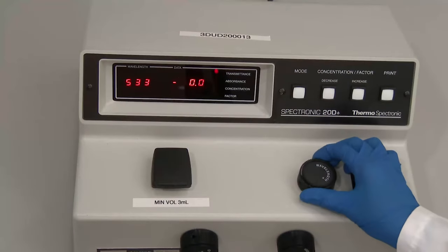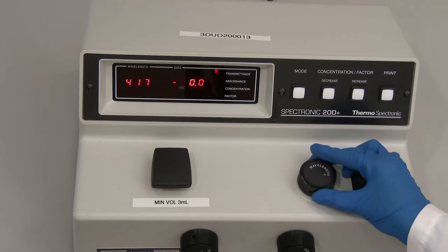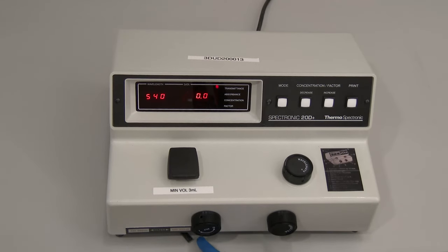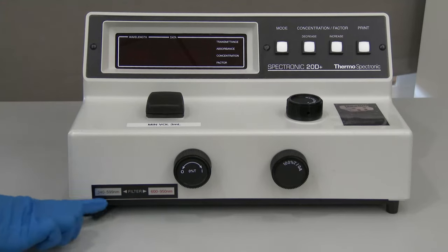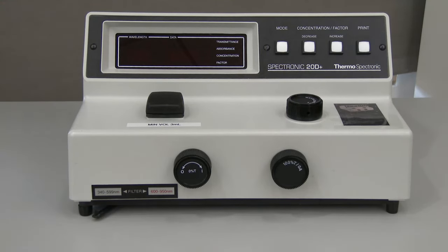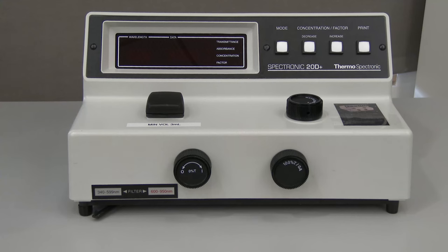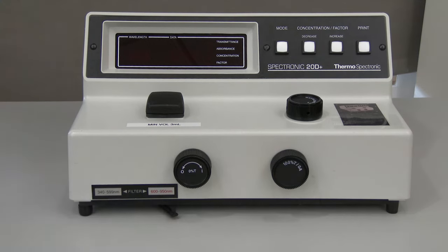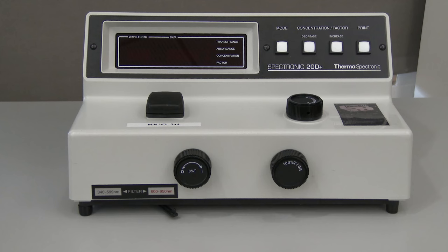The instrument should be allowed to warm up for at least 15 minutes prior to use. After the instrument is warmed up, set the desired wavelength by turning the wavelength control knob. Set the filter lever to the appropriate position for the selected wavelength. For example, if the desired wavelength is 450 nanometers, the lever should be positioned to the left so the 340 to 599 nanometer filter is in place. If the required wavelength were instead 650 nanometers, the lever should be positioned to the right so the 600 to 950 nanometer filter is in place.